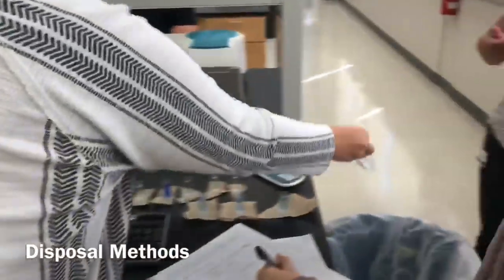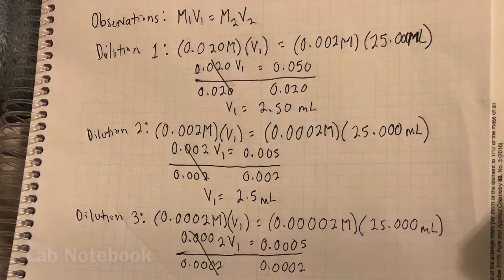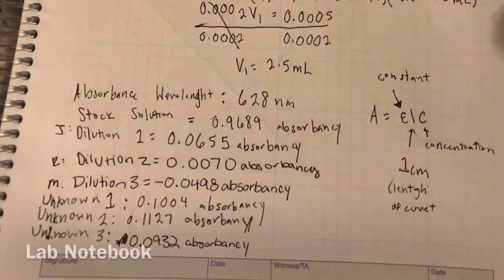Here, Rachel is properly disposing of the materials used in the spectrophotometer room. Here, our lab notebook is clearly shown, and it includes labeled samples of decreasing concentration, absorbance data for all samples, and all significant figures are recorded to the correct decimal places.